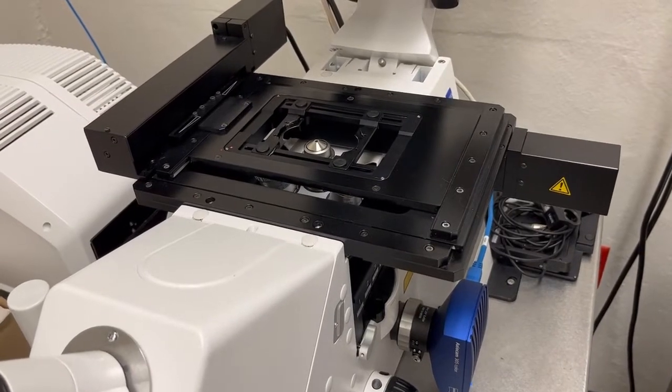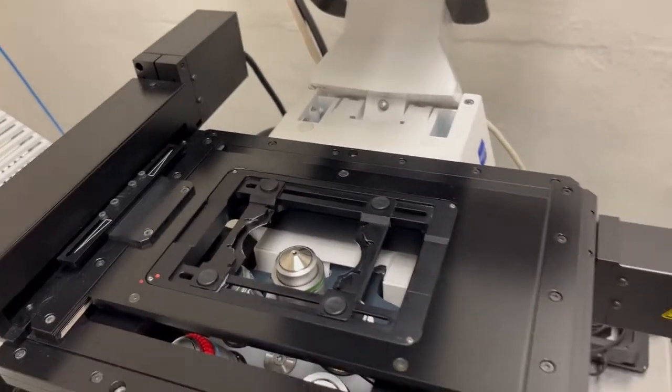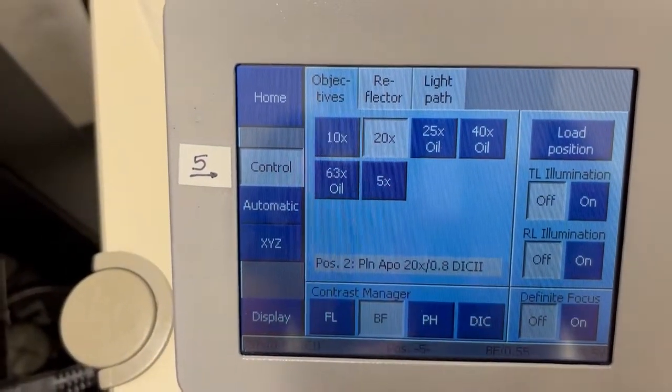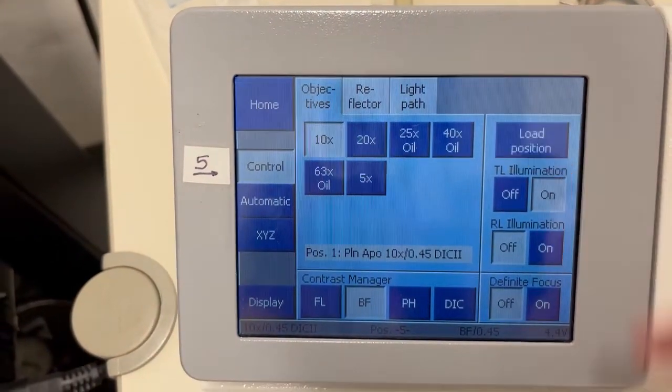Before you put on a sample, it's a good idea to check whether the sample holder is in the proper position. So to do that, I strongly recommend you switch to the 10x objective by clicking on the 10x here, and then lower the objective fully by pressing load position. Load position drops the objective all the way to the bottom.